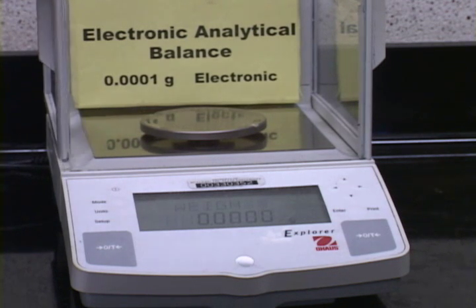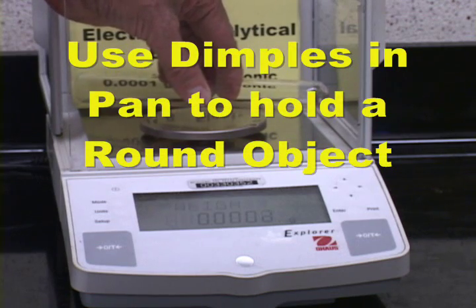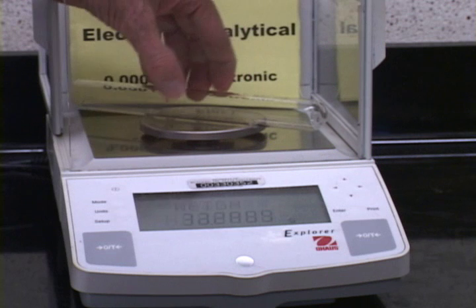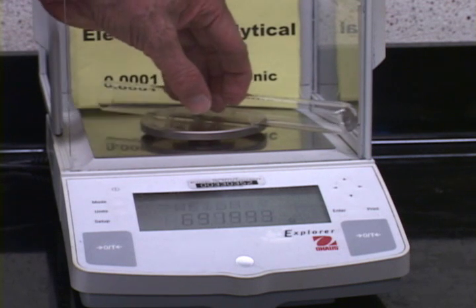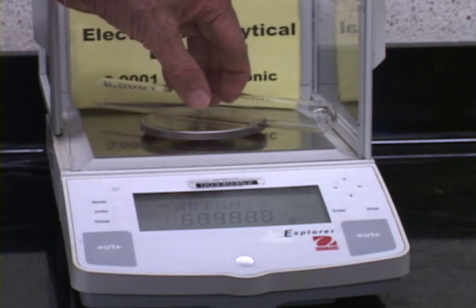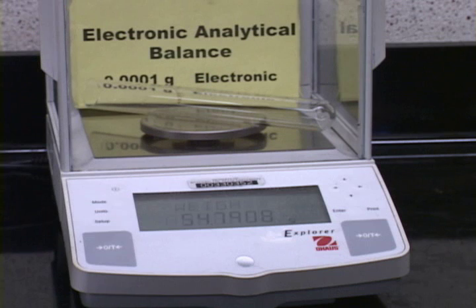If you weigh cylindrical objects, long cylindrical objects, any cylindrical object though, make sure you put them on these 2 little dimples in the pan. And then the other thing is make sure that you have set the object so that it will not touch the side of the balance. You will not get a correct reading if the object is touching the side.